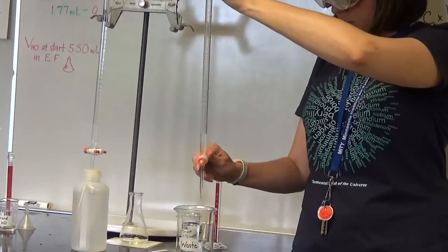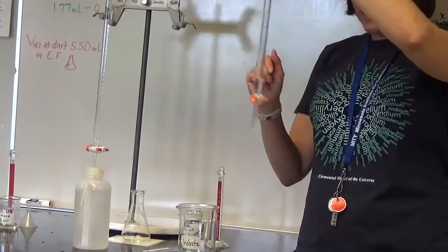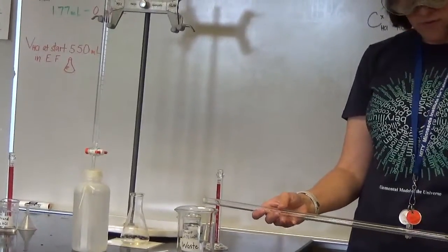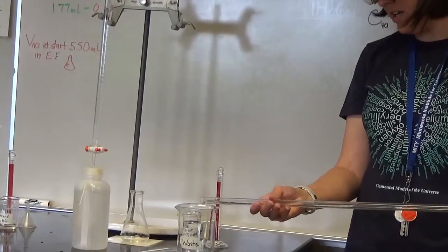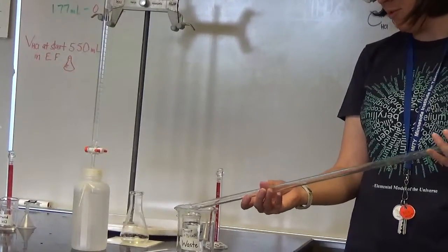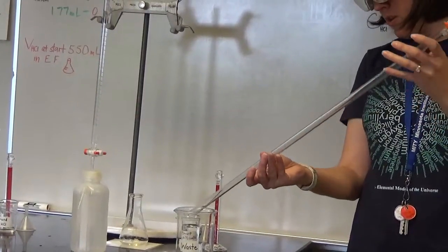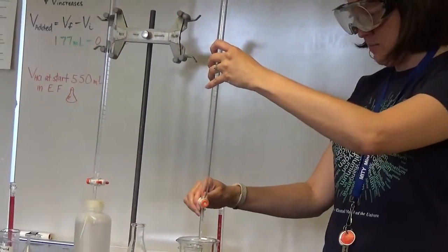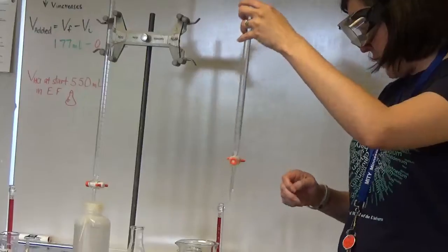I'm going to allow some of the water to exit out the bottom, and then I'm going to close it back up. And then I'm going to swirl as I allow all of the water to exit the top of the burette into the waste container. So I'm just cleaning it out. I don't know who used this burette before. I don't know what they were using, so I don't want their stuff in there. Hopefully they cleaned it out before, but you never know how well they cleaned it out. So I've got most of the water out. I'm going to do one more open down here just to make sure I get all of what's in there out. And now I'm going to clean with some NaOH.